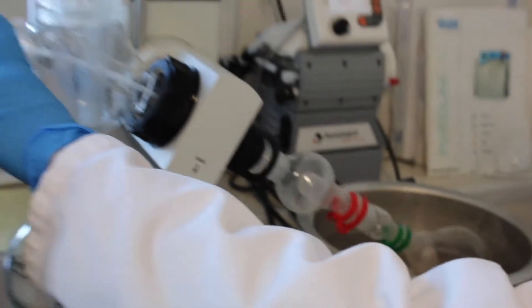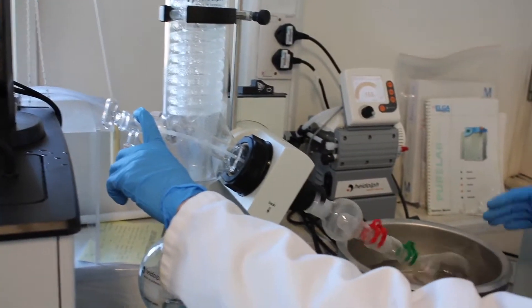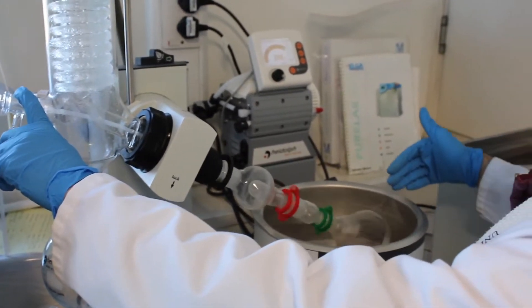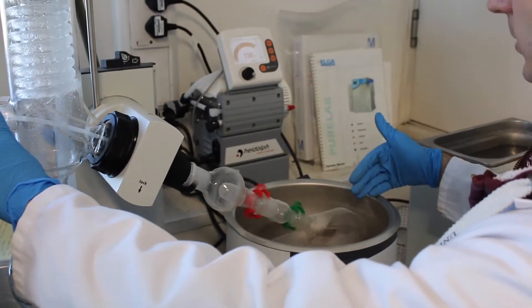So that's why you want to hold your finger on the valve there and be ready to release the pressure if your solution starts to boil too much.